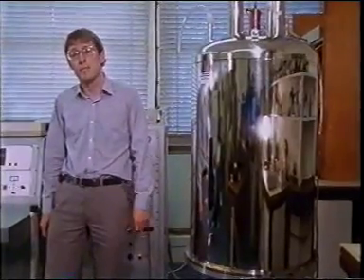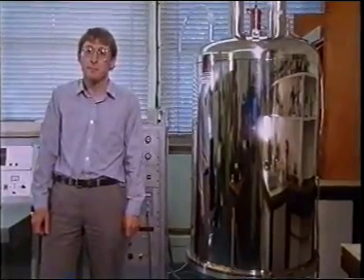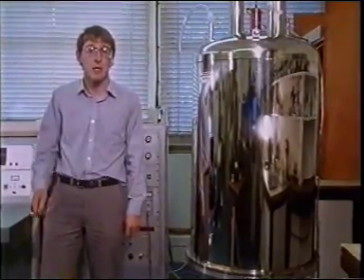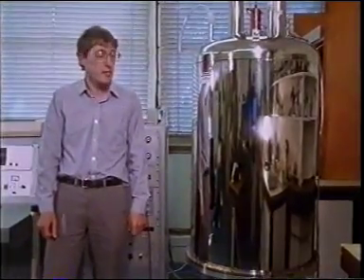This is one NMR laboratory in the Department of Chemistry, and I'm here to show you a typical NMR instrument and some of its capabilities. I also hope to indicate just how powerful and sophisticated the NMR method has become. We'll concentrate on proton NMR spectra, as you learned quite a lot about carbon-13 NMR spectra in your second level course. Let's start with a schematic of the instrument itself.